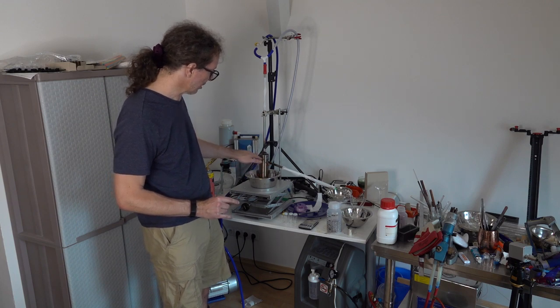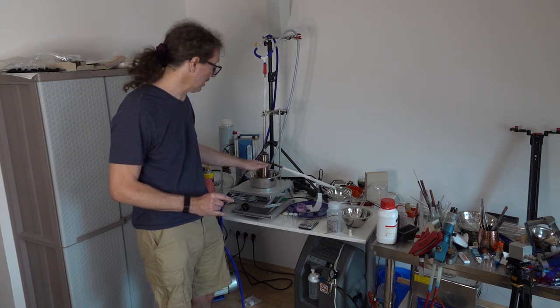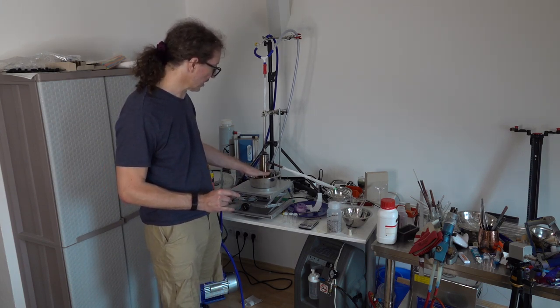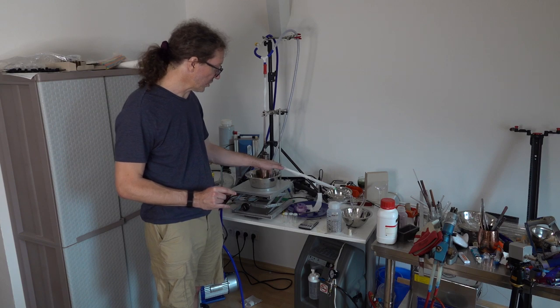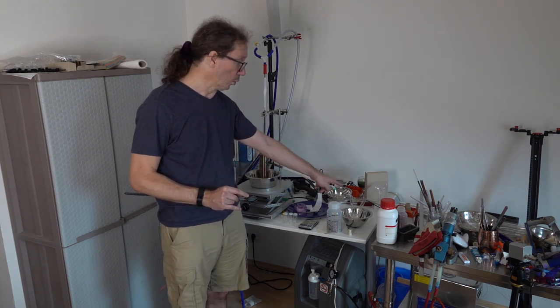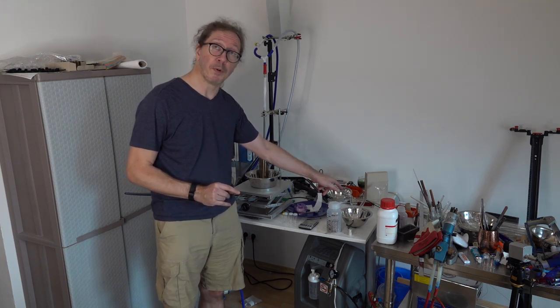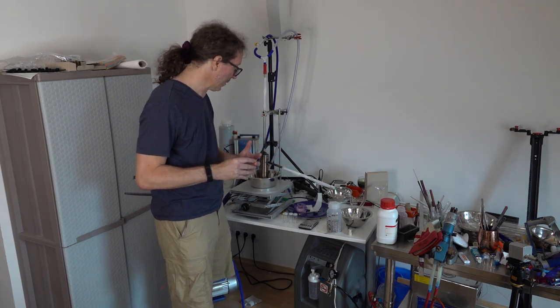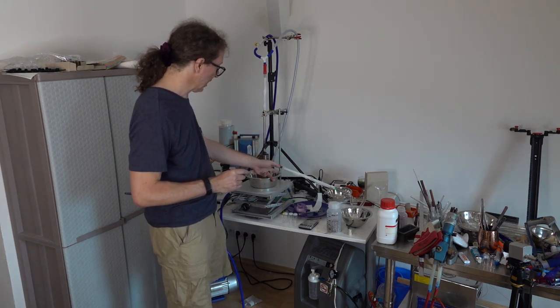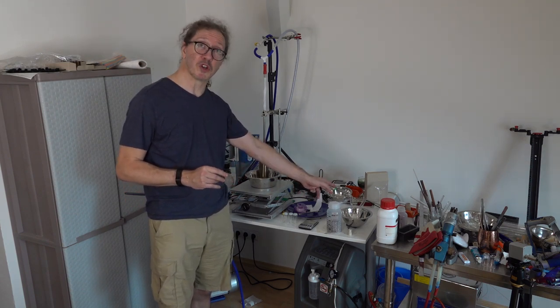So I'm going to have 600 degrees cesium atoms bouncing around in here, and they're actually a fantastic heat transfer agent. So once this gets up to 650 at the bottom, and I get a vapor pressure of cesium, this will heat up very quickly, and cesium will start condensing on here, and I've got to get it cool enough by the time it gets down to this end of the kit. This is my epoxy seal. I don't want my epoxy seal to fail, so I want the epoxy seal well below 100. So I've got to cool it down from about 400 degrees here, or 600, to room temperature here.